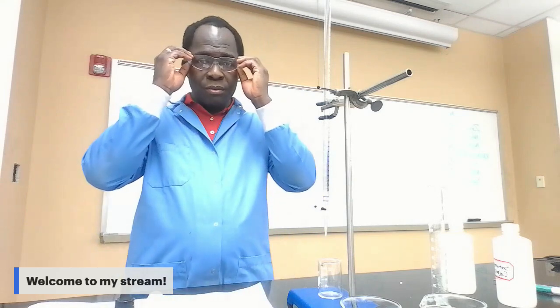Okay. Before we start the lab, I want to quickly remind you about safety. You need to have your goggles on, your lab coat, and shoes that completely cover your toes before you come to lab. And when you are in the lab too, make sure you have those on all the time.